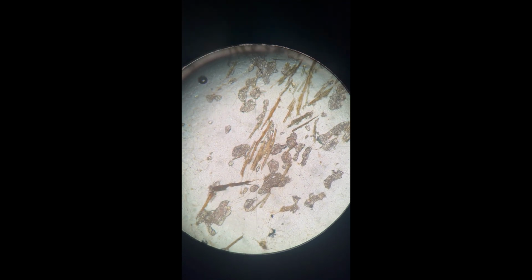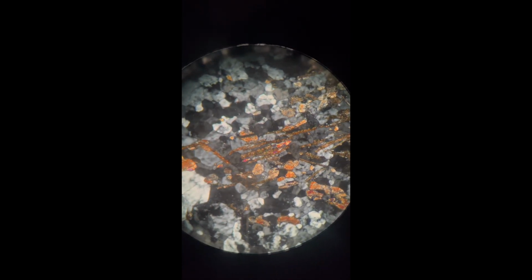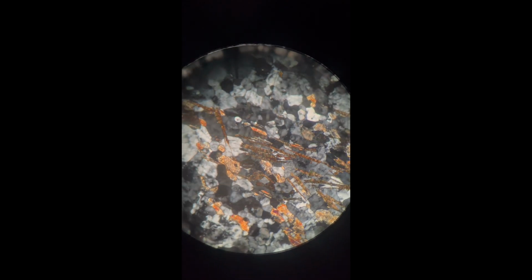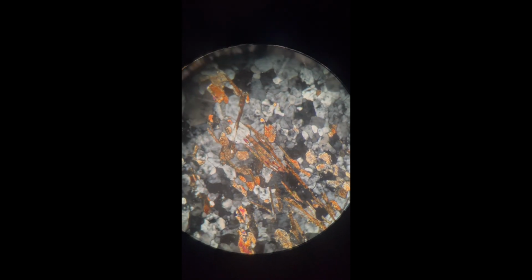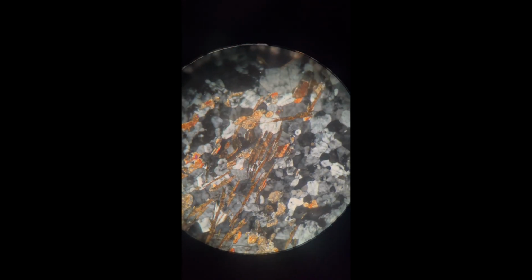When viewed under cross-polarized light, biotite reveals second-order interference colors and shows bird's eye extinction. It also displays a sign of elongation, being length slow. Biotite, which is a phyllosilicate, is commonly found with felsic igneous rocks with a phaneritic texture, specifically granite.